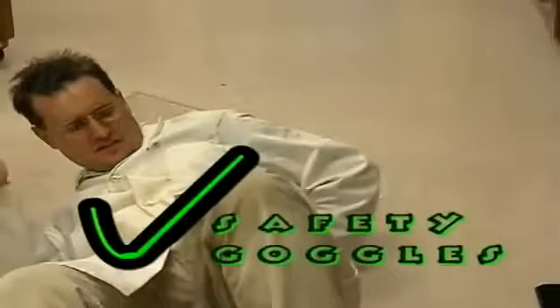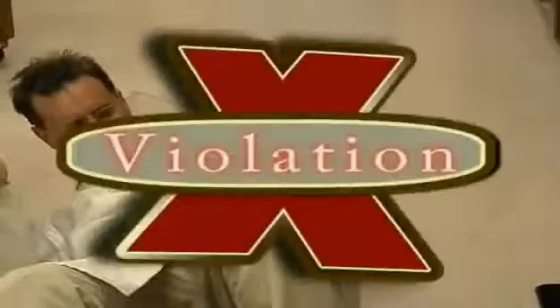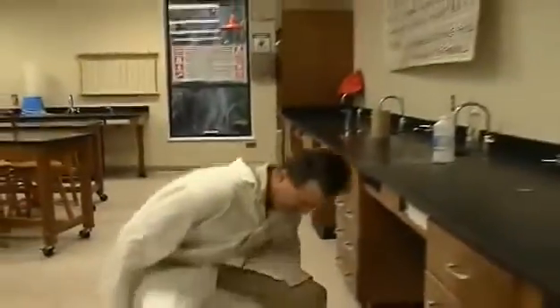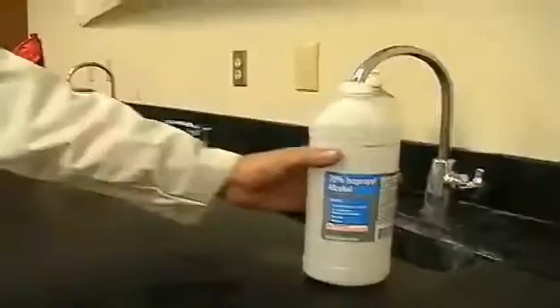Oh. Thank goodness I had my glasses on. Oh? Wrong! Violation! Always wear safety goggles. Prescription glasses are not acceptable. That's not water. Isopropyl alcohol. Ugh.